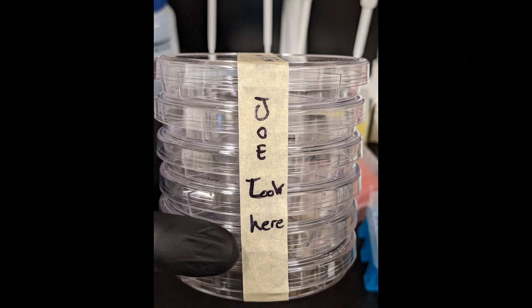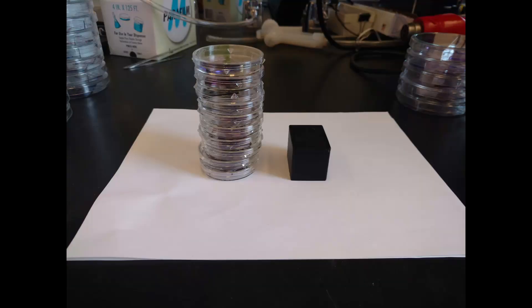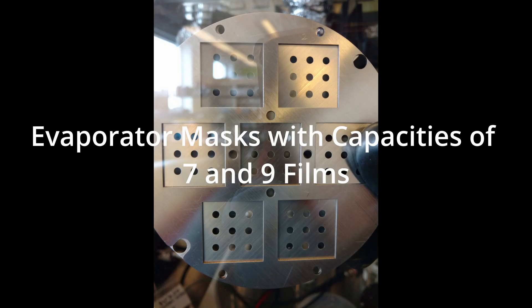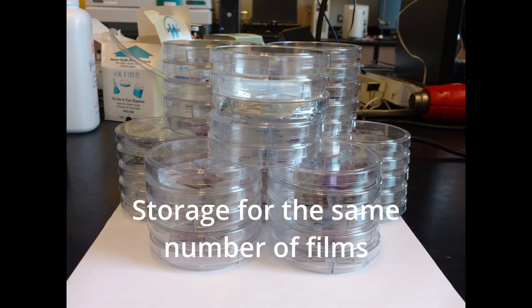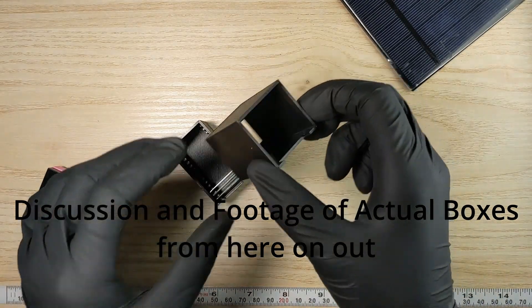In several labs, I have found that devices are often stored in disposable plastic petri dishes that sometimes have an internal divider separating the dish into four quadrants. I find these problematic for a number of reasons. It's rare that a process using physical vapor deposition or sputtering produces only four films per batch, and suddenly you require multiple petri dishes. The dishes are never fitted to the substrate, so they can rattle around, in some cases flip over, you risk damaging the film, or when you mix different films together, it can be nearly impossible to differentiate them.